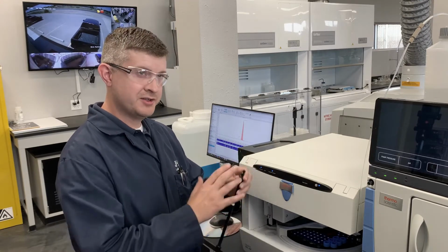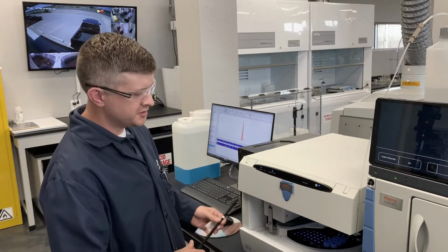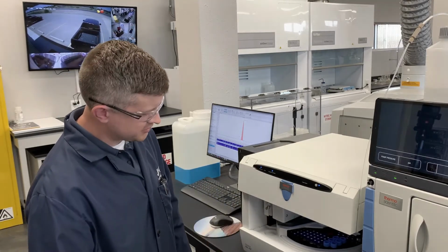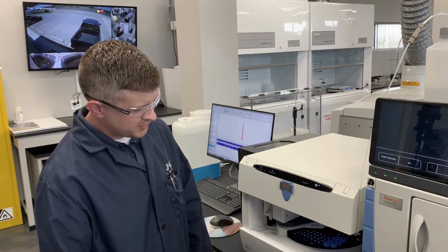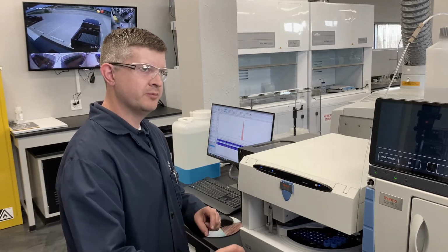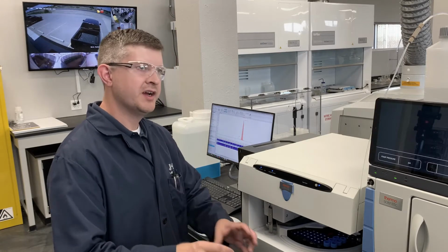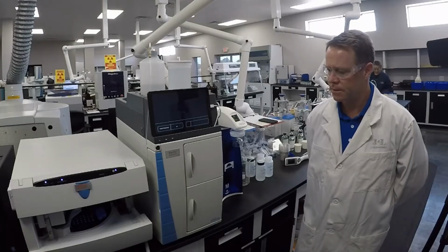By the time they make it to the detector, they're separated far enough that we can detect and quantitate each species. And the auto sampler here right now is actually doing some dilution and sample prep work for us. So while it's analyzing a sample, it's actually diluting and preparing the next sample for us, so that by the time the first one finishes, it's ready to inject the second one. So there's very little downtime there. So it sounds like it can speed things up pretty quick.